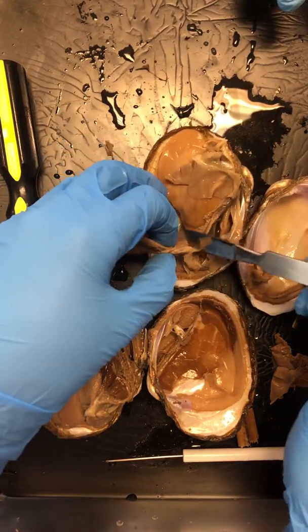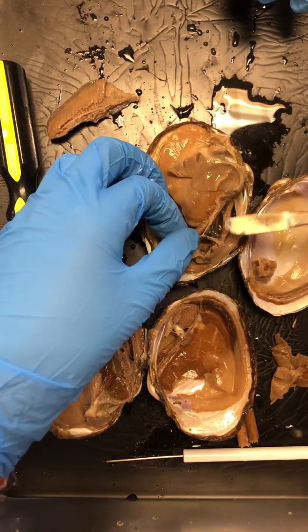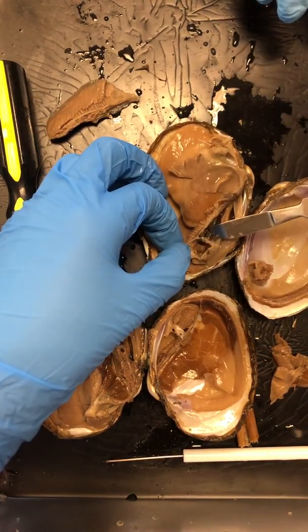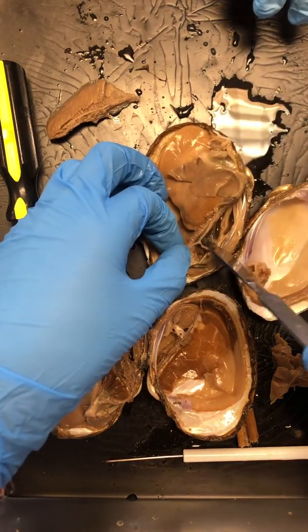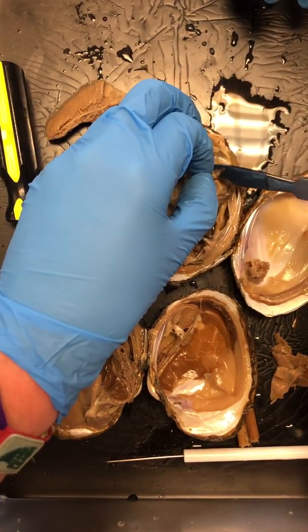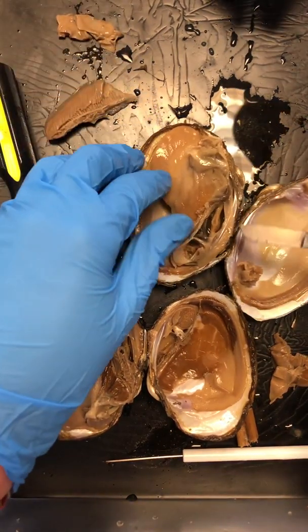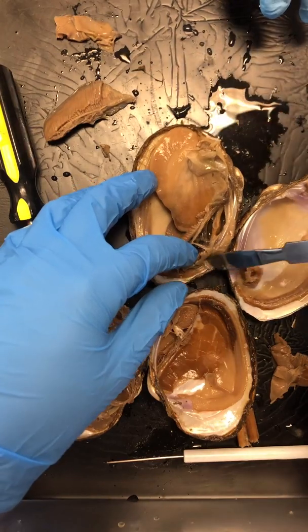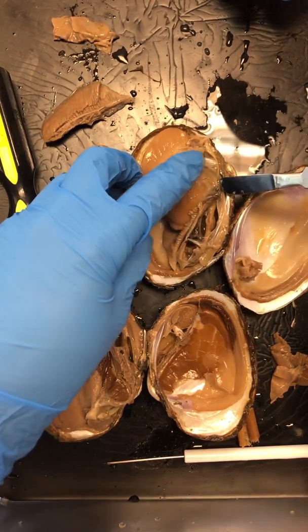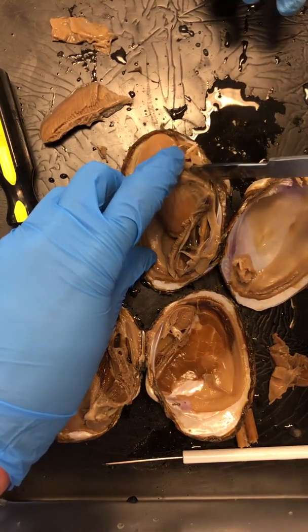Okay. So here we just took out the gills because they're big and floppy and kind of get in our way. This dark line that we're seeing is our intestine. So this black stuff here is digested food. Gross. Which is kind of cool. But what's neat about our mussels is that their intestine actually travels right past their heart, which is a little bit dangerous in case there's ever a rupture or anything. This intestine comes out through the butt over on this side. If we travel it backwards, it travels all the way up here. Your heart is going to be underneath this guy over this way. And then its mouth needs to be over here.